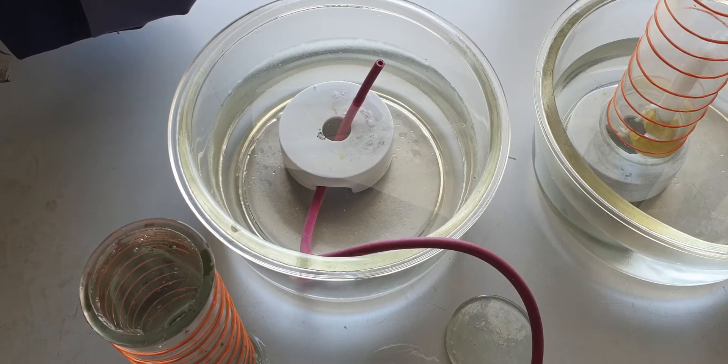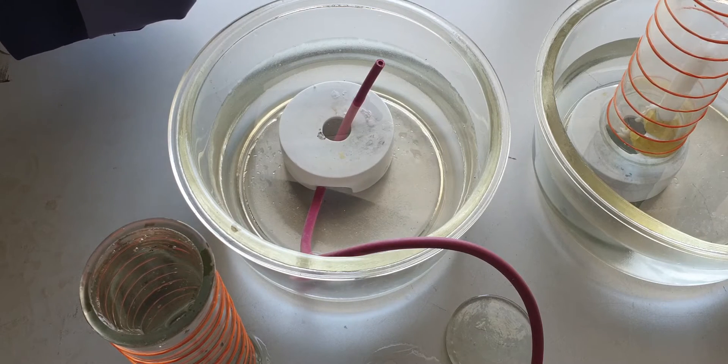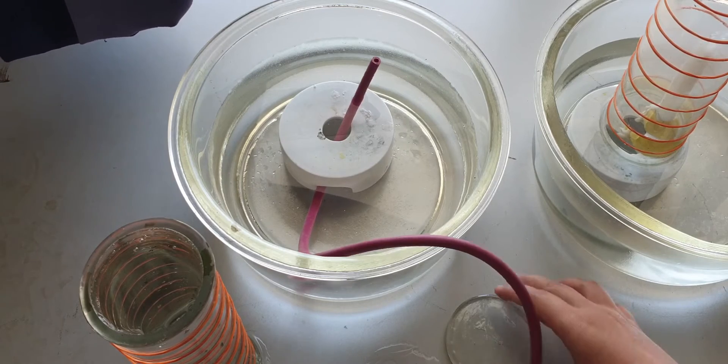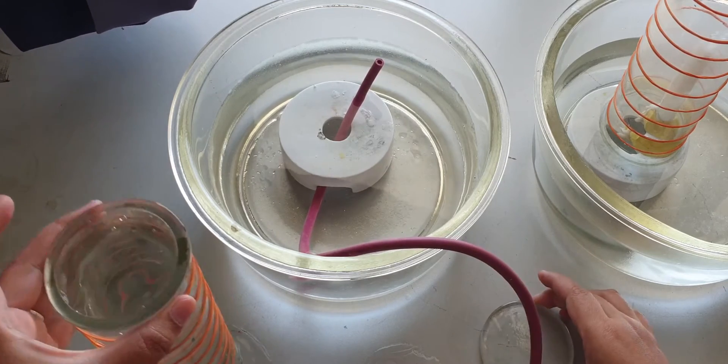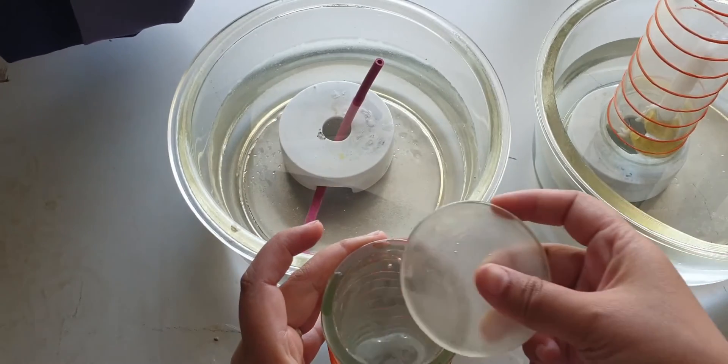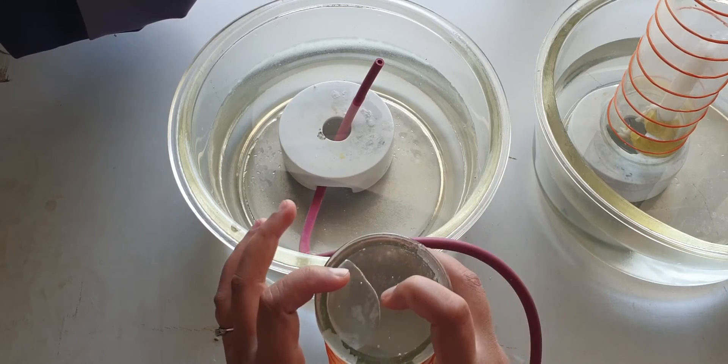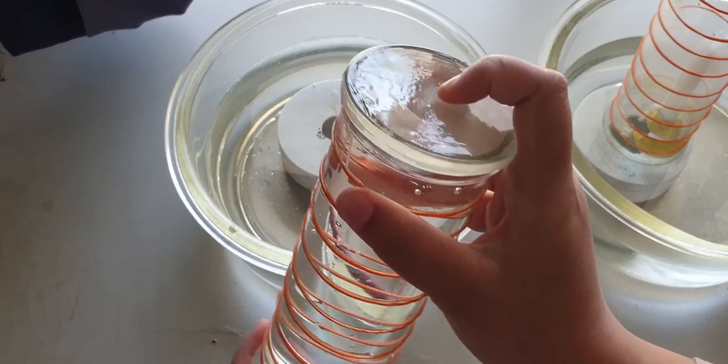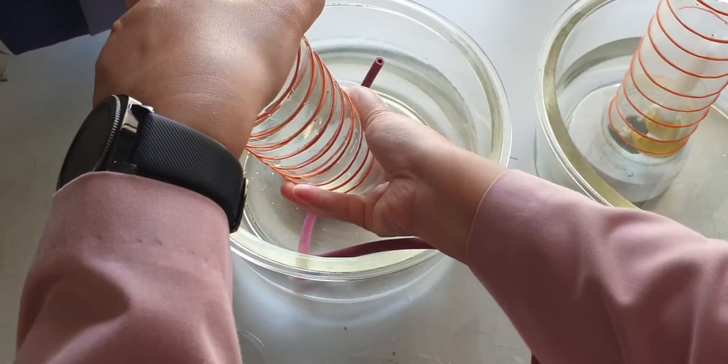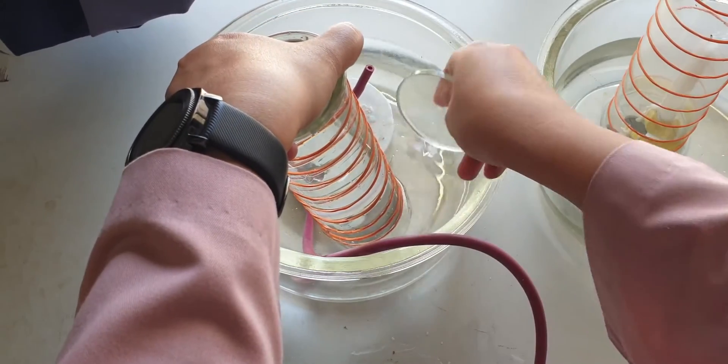Then I'm going to repeat the experiment by using exhaled air. Collecting the exhaled air is quite tricky. So what I did was I filled the gas jar full with water and I covered it with a glass cover. And then I inverted it into the water immediately, take out the glass cover.